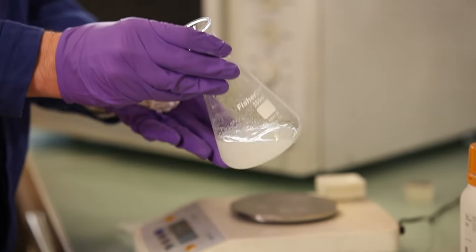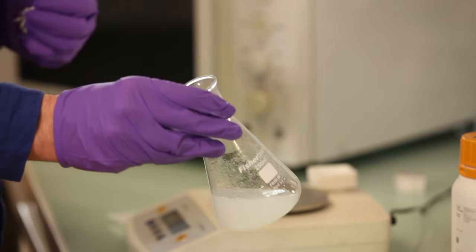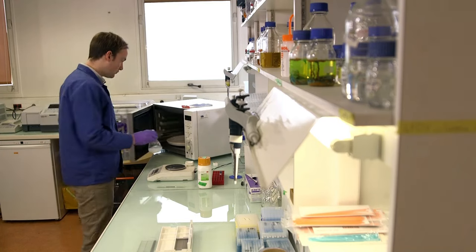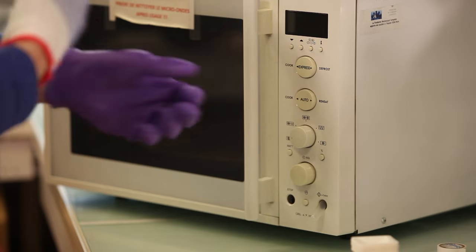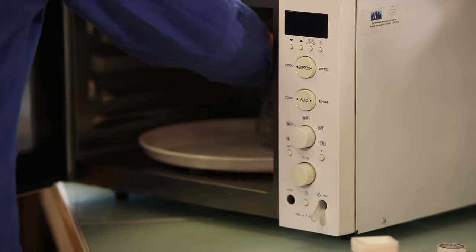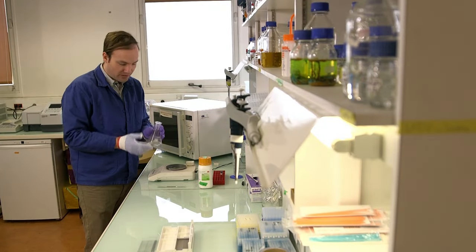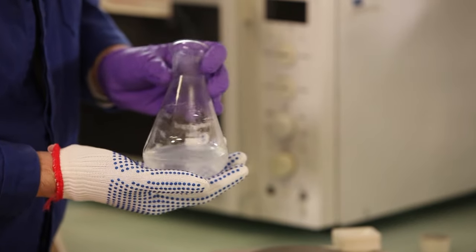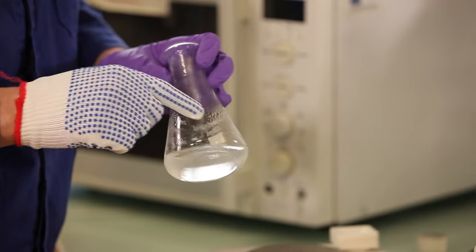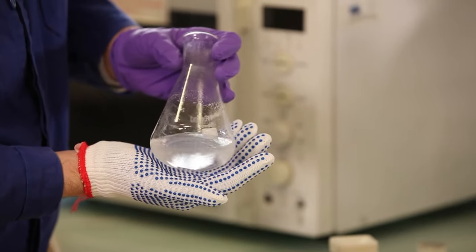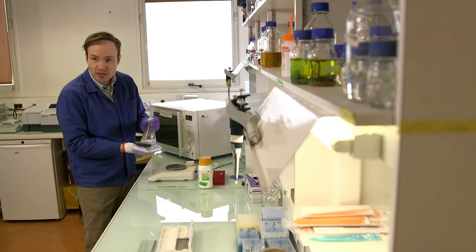Now to dissolve this agarose and form the matrix, I'm going to microwave this solution for about a minute. So here we are after 30 seconds. You can see that the agarose is starting to dissolve, but we can still see particles of agarose sticking to the sides and the solution is not completely clear. There's a lot of little grains of agarose in there and it's a little bit cloudy. So this is not yet ready.